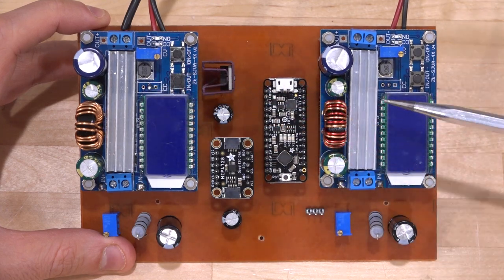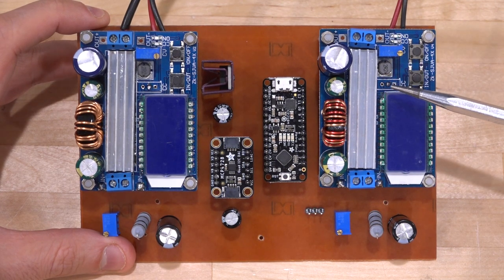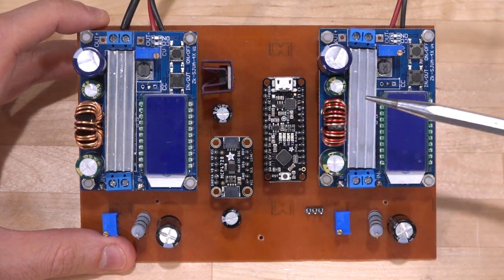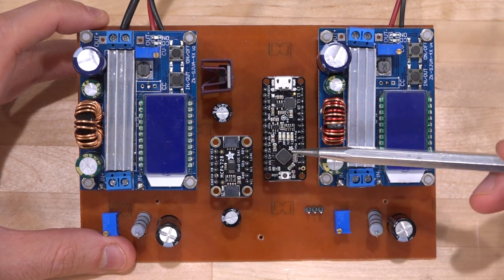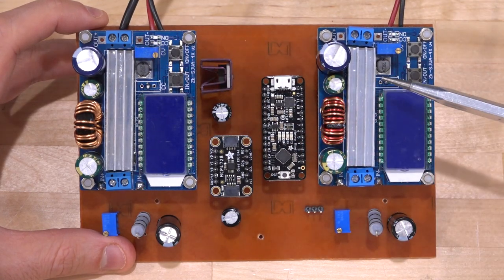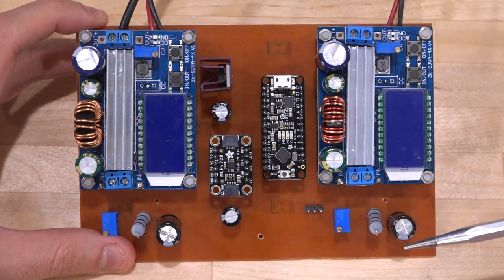So I just simply removed the current control potentiometers, and I took the analog voltage that used to be created with that potentiometer, and I connected it to a DAC. So now we have a DAC with multiple outputs, and the DAC can control the maximum current set on each of these two completely independently. And that is driven then by an Arduino. So basically what I can do is I can set the top LED anywhere I want in brightness, and I can set the bottom LED anywhere I want in brightness, and I can even set them at the same time, which is something the microscope cannot actually do.